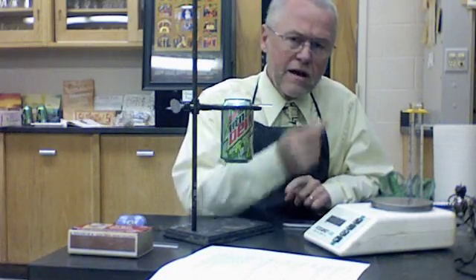The basic idea in this lab is that energy is conserved. I have a peanut — actually I'm going to use a cashew for my demonstration. If I can capture the energy from this cashew and transfer it into water in this can, which is my calorimeter today, I can see how much the temperature changes and calculate how much energy went into the water. From that, since that should equal the energy that came out of the peanut, I can figure out how many joules of energy are in it, then convert that into calories.